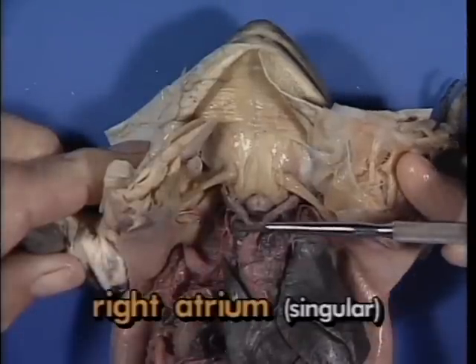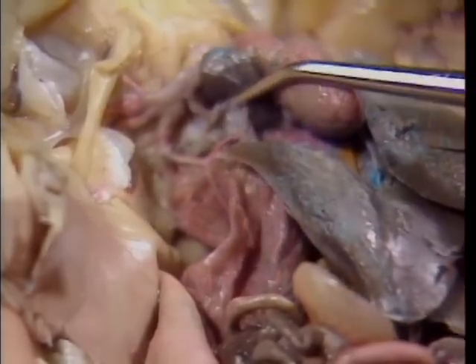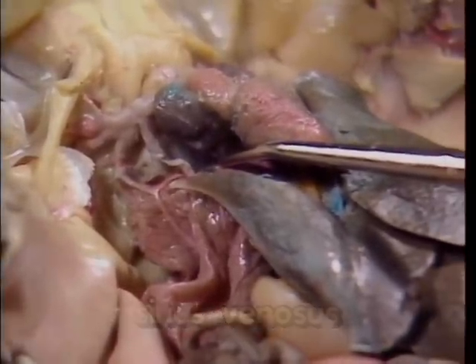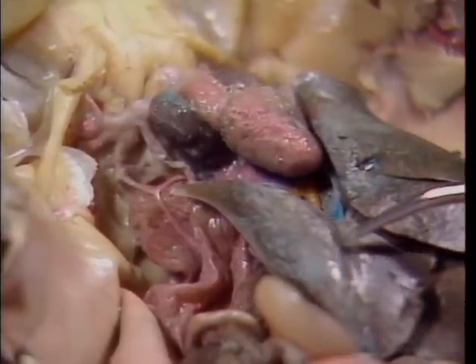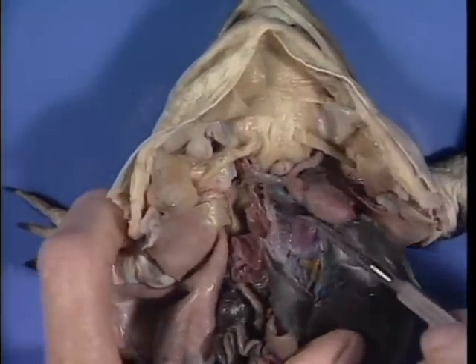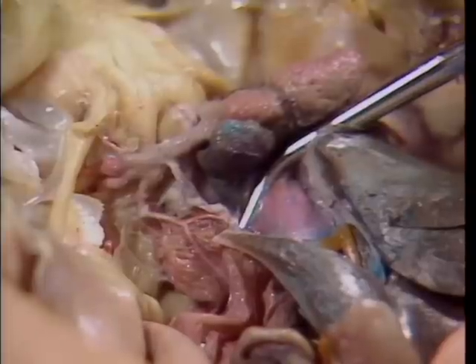Attached to the right atrium is a thin-walled sac known as the sinus venosus. The sinus venosus receives blood low in oxygen and high in carbon dioxide from all parts of the body. 3 major veins, shown here, injected with blue latex, collect the blood from the body and carry it to the sinus venosus.